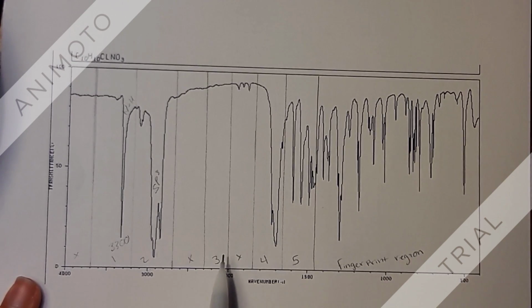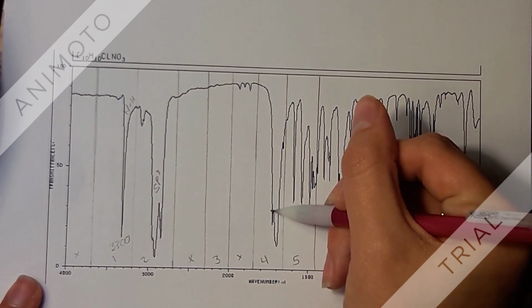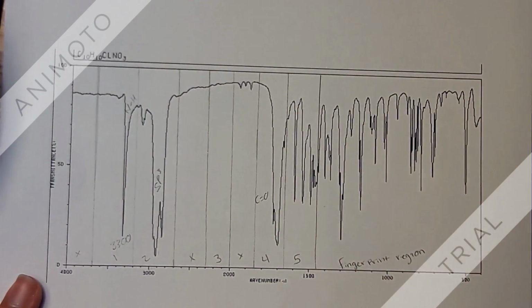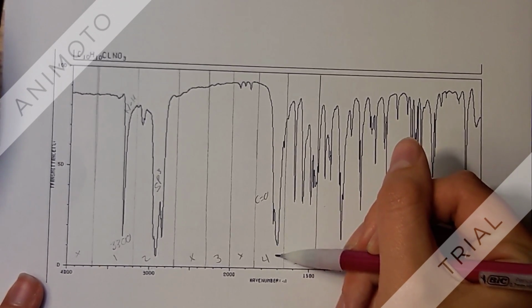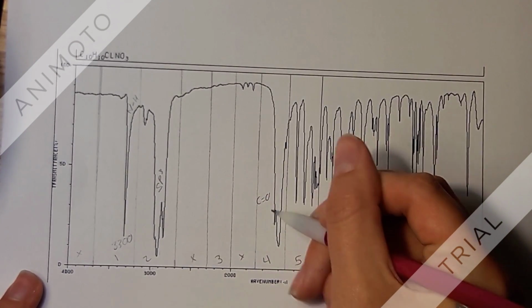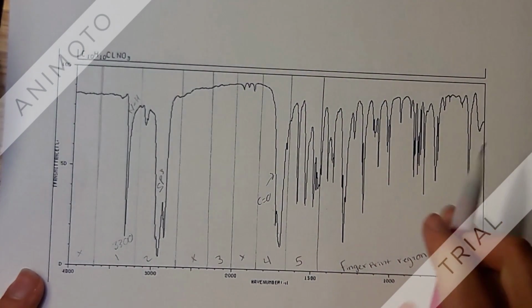Going on, zone 3 doesn't have any signal, so we're not going to worry about that one. Then zone 4 shows this peak right here. Zone 4 typically shows carbonyls, which is C double bond to O. And so this region tells us that it's probably a carbonyl, and because it's on the lower side, it could be a carbonyl for an amide. But it looks like there's 2 peaks, so 2 separate peaks, so there could be more than one. So we'll just keep that in mind and know that this region is showing C double bond to O.